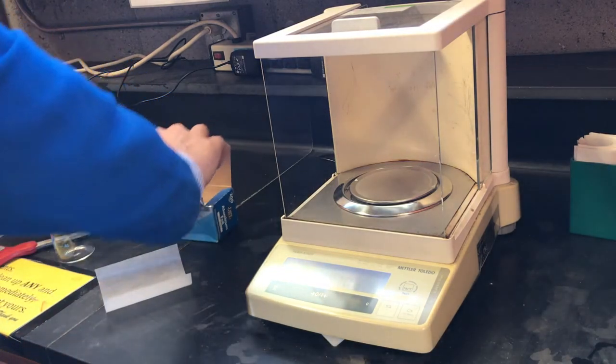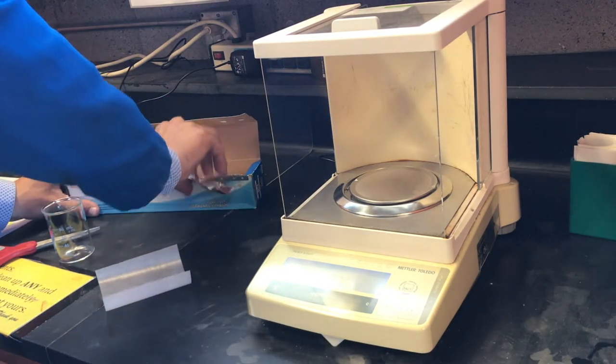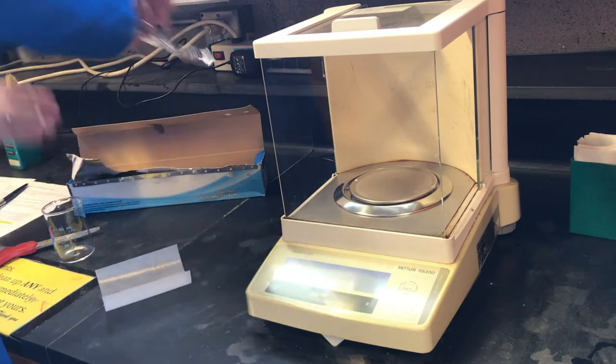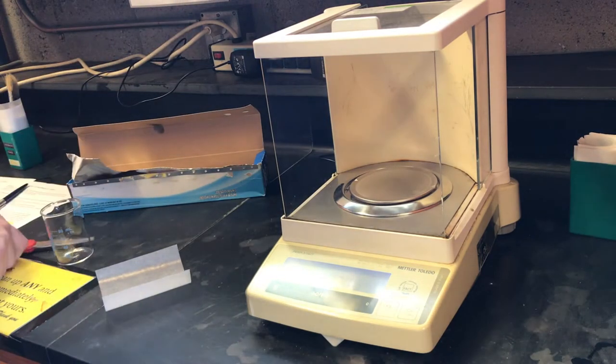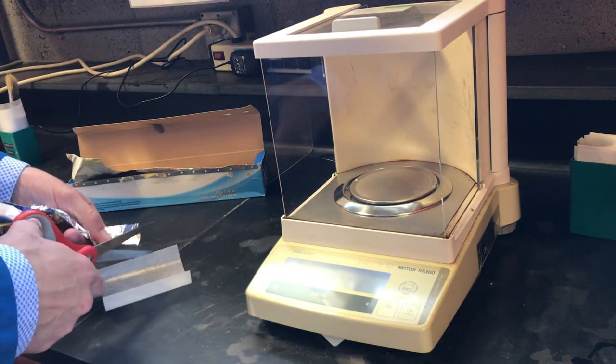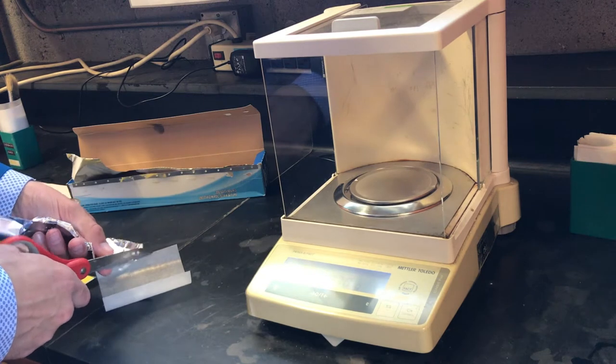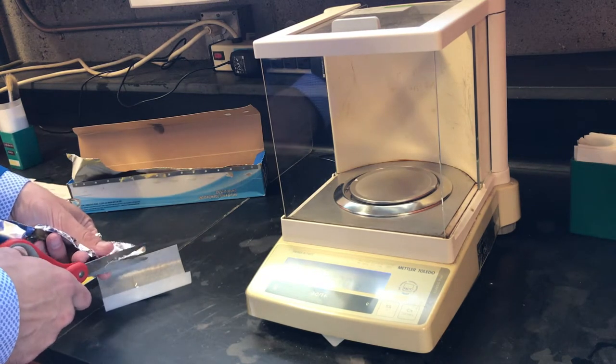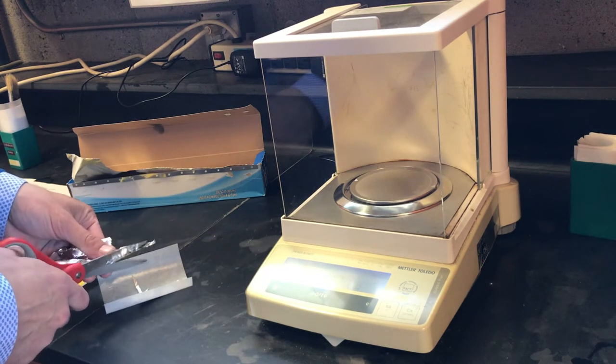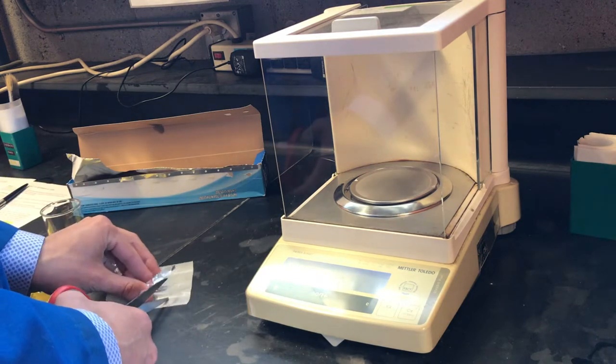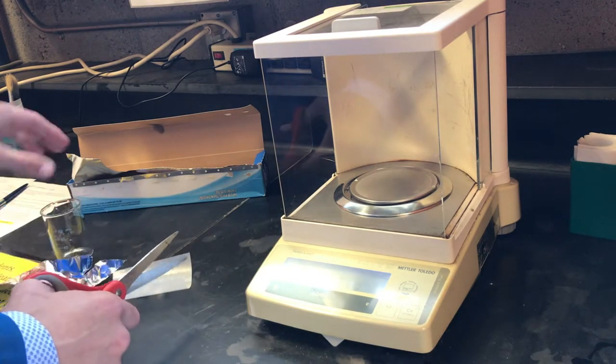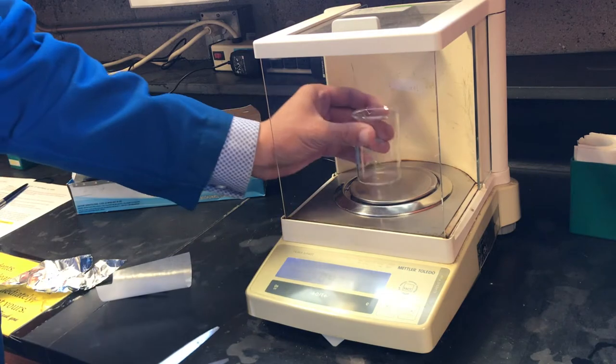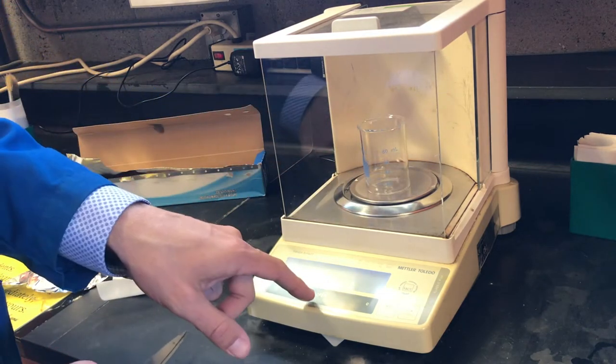Today we aim to synthesize the ubiquitous compound potassium alum dodecahydrate from common aluminum foil. We're looking to begin with 0.500 grams plus or minus 50 milligrams of foil. The most important thing is to record the exact mass of our foil for later yield determination.